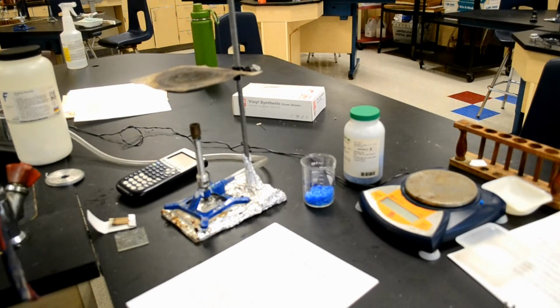This reaction involves a color change from blue to almost white, where copper(II) sulfate·X hydrate will form copper sulfate plus X moles of water. The copper sulfate X hydrate is blue. The copper sulfate is white. This lab should help you understand hydrates and the law of definite composition.